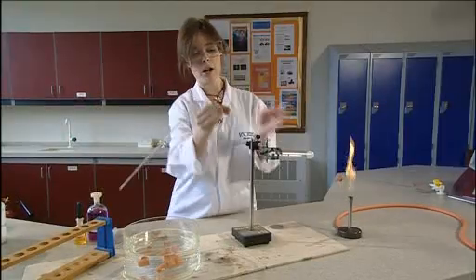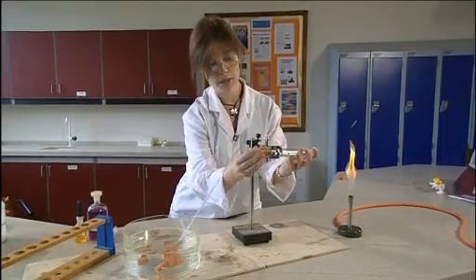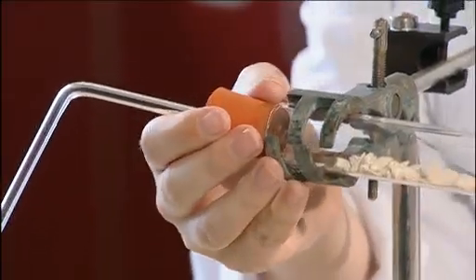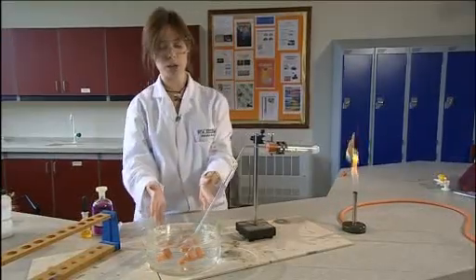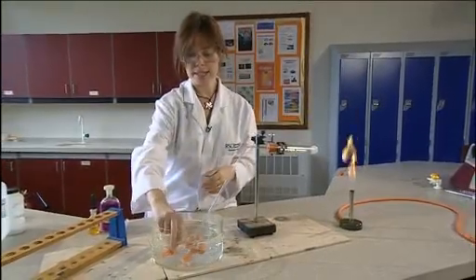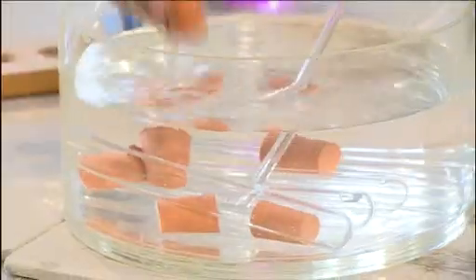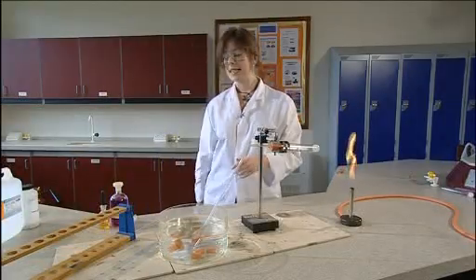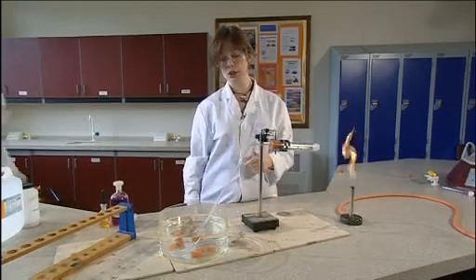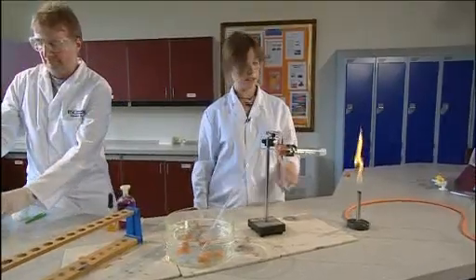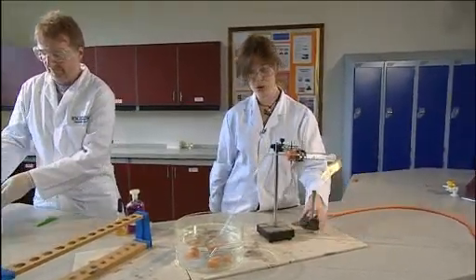You attach a bung with a delivery tube to the mouth of your boiling tube. I've already prepared a bowl of water with about six test tubes also filled with water and some bungs. Next you need an assistant who could possibly be a competent student although actually I often do this experiment with two students.